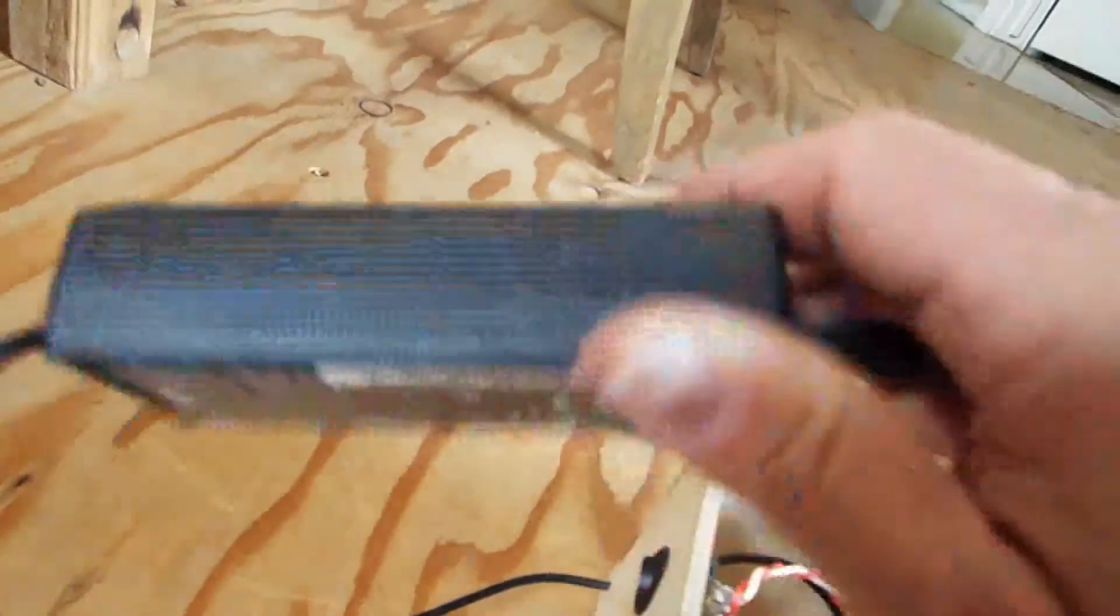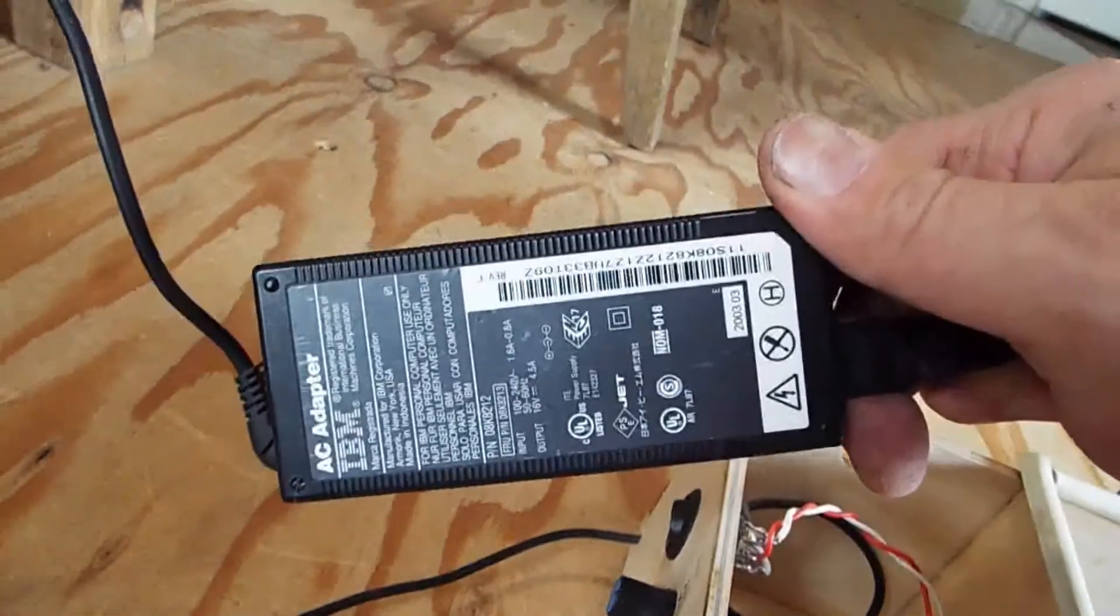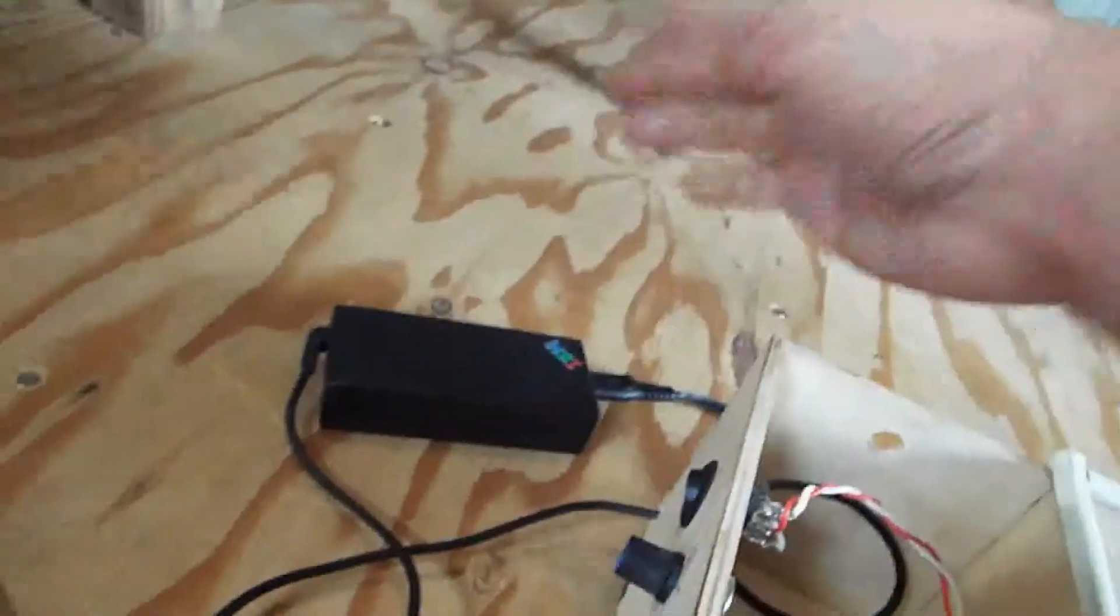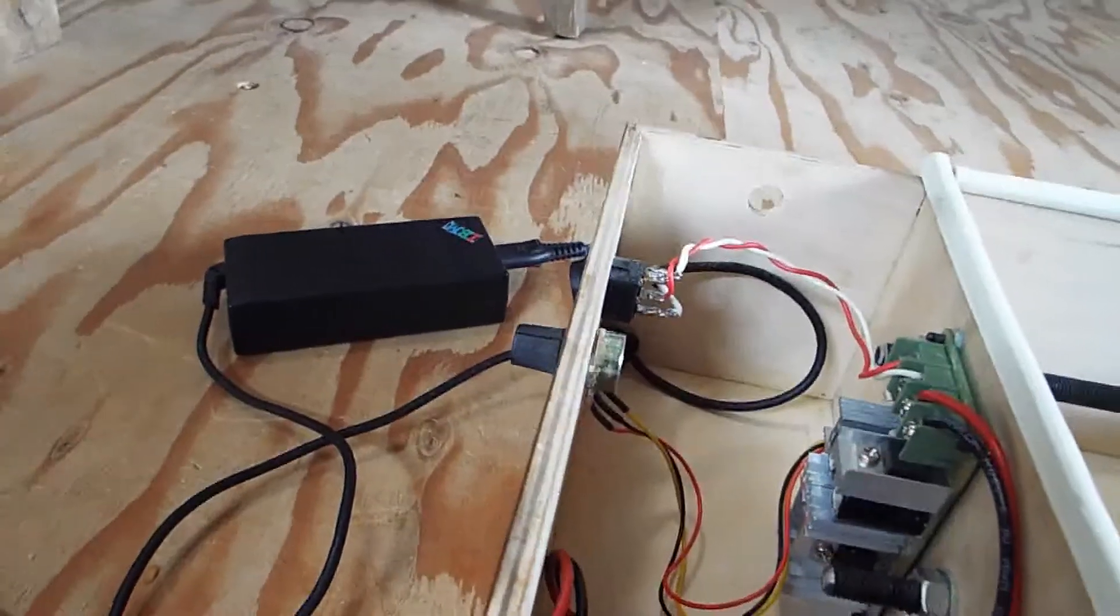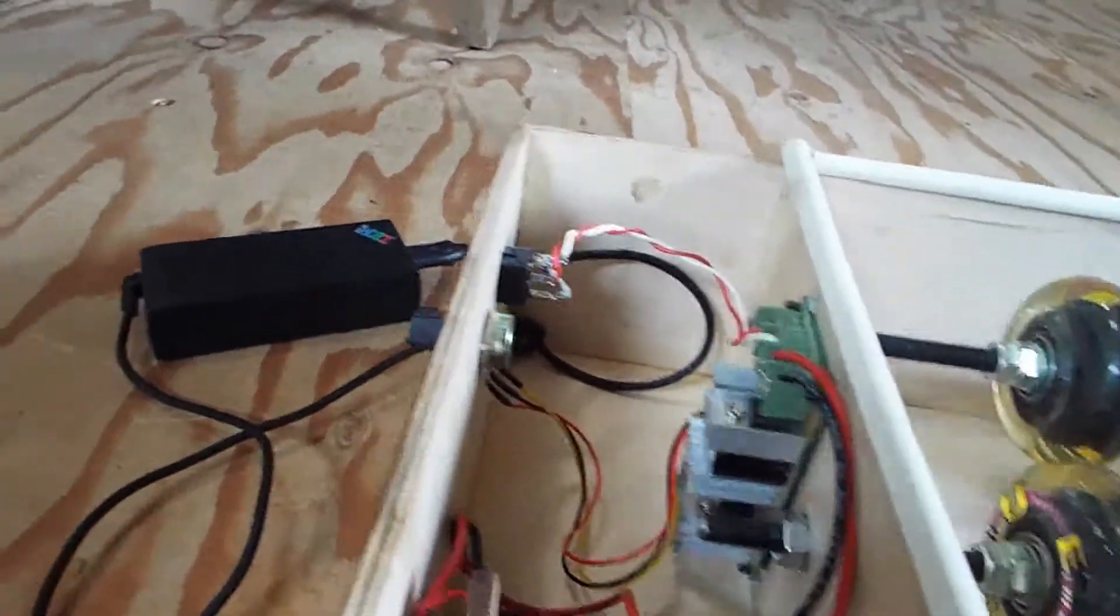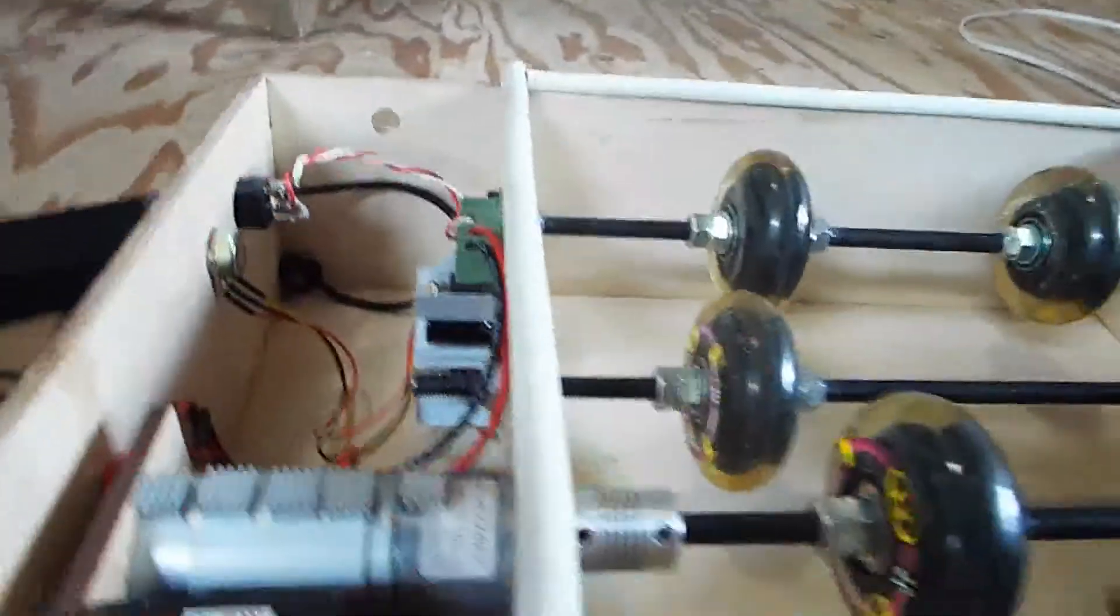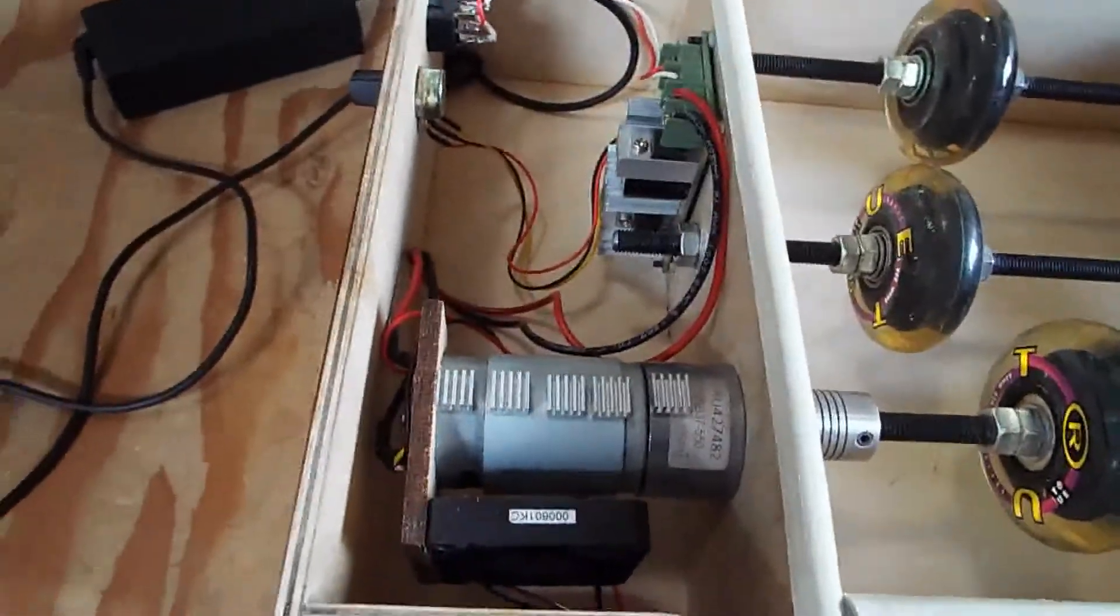The main power supply for the PWM controller is a laptop power supply. I picked a laptop power supply because I have a bunch of them in my junk box. They're easy to get on the store shelves so it's easy to replace. Everything in here is pretty easy to replace.